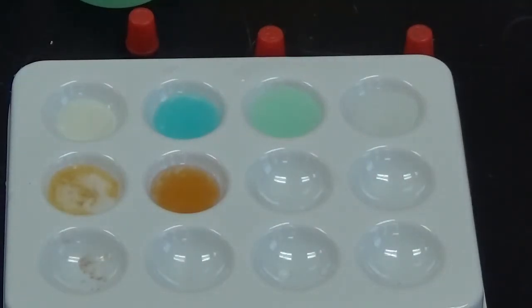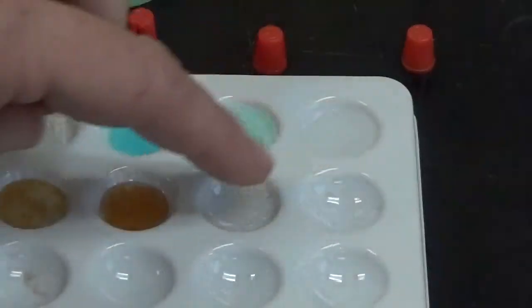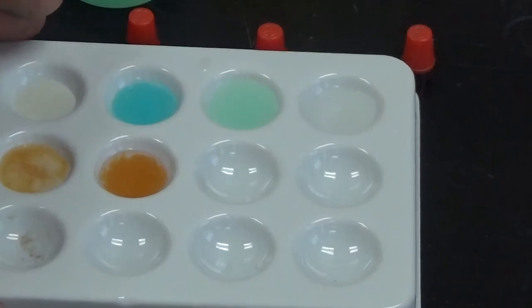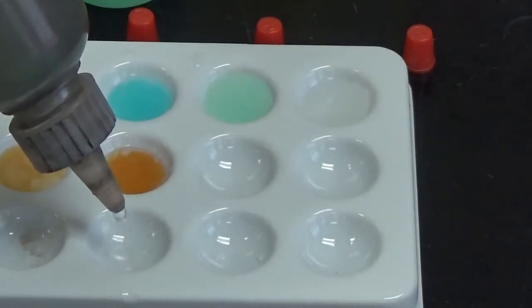Now we're going to finish using this tray, but this time we are going to put silver nitrate in 5 of the wells. So I'm going to put it across the bottom in these 3 and here, because this one is stained, I think, but I'm not 100% sure. Could be some residue, so I'm going to put it in here.